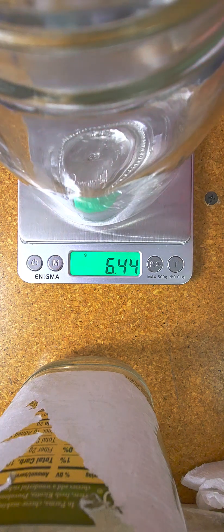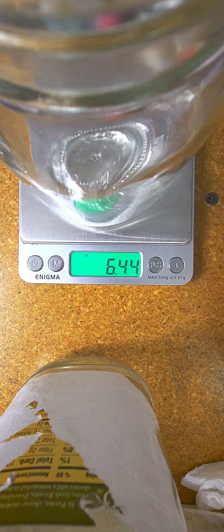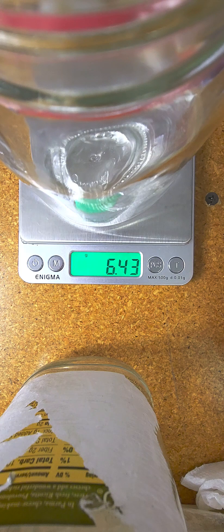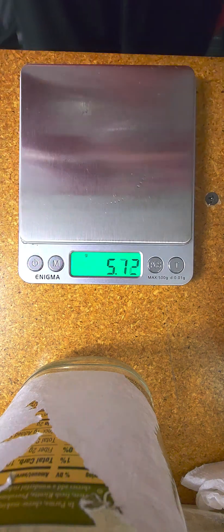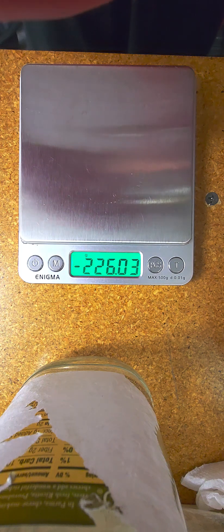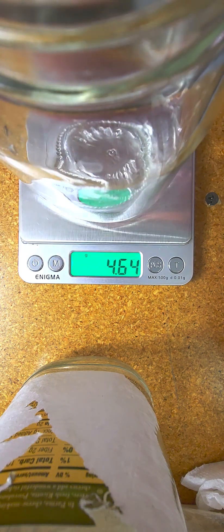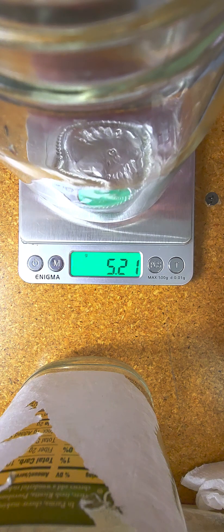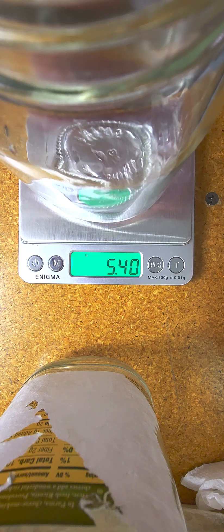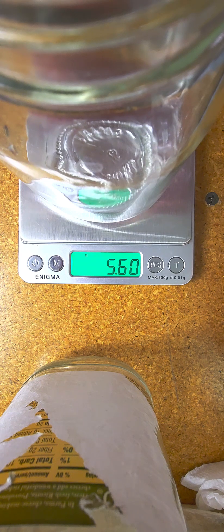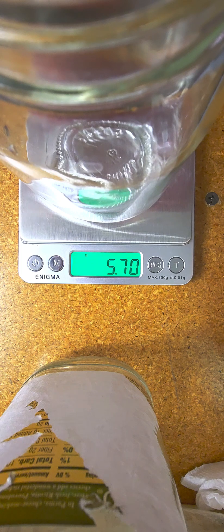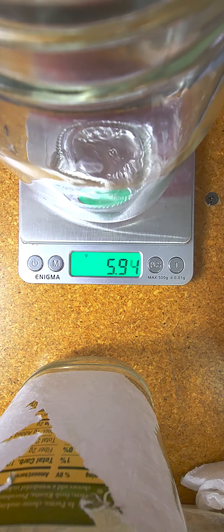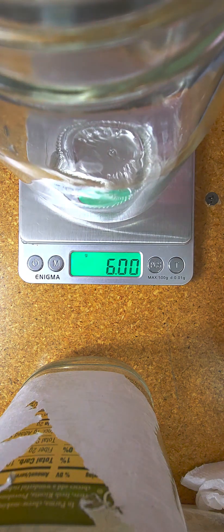Adjusting the measurement to get exactly six grams. There, perfect.